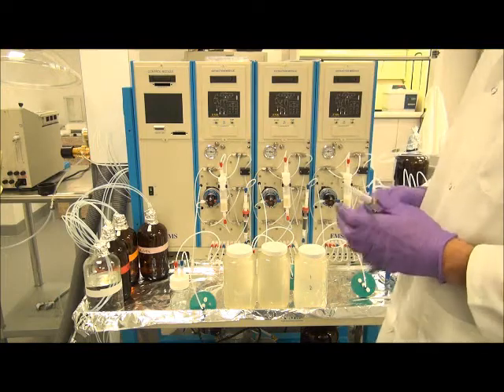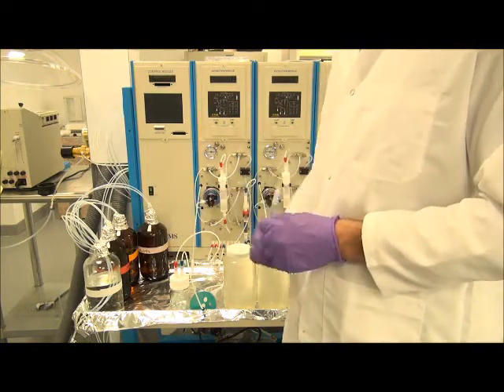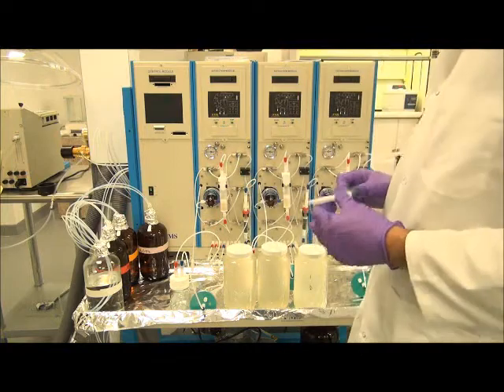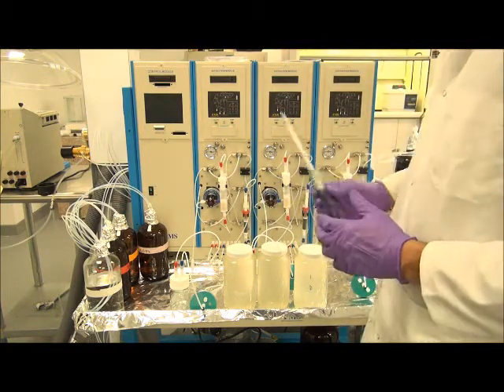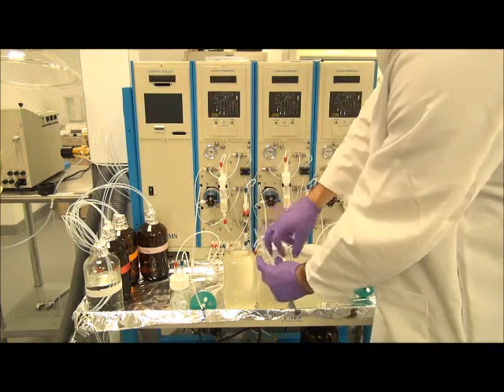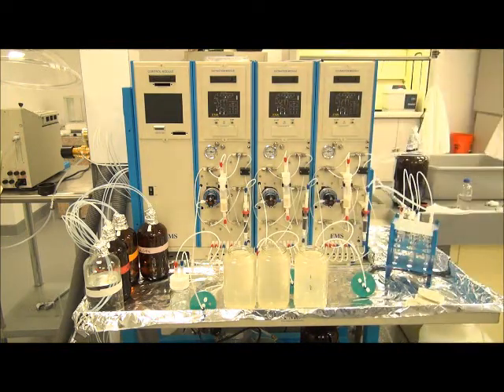The system's solvent delivery consists of 4 different solvents: a DI water matrix, methanol, methylene chloride, and a 1% ammonium hydroxide in DI water solution for changing the pH of the cartridges. The first step in the method, as we prepare the samples, is to adjust the pH of the samples to less than 2. This will be done by adding a hydrochloric acid solution to the samples and then checking the pH of each bottle.